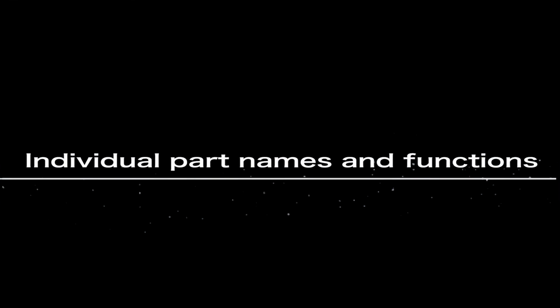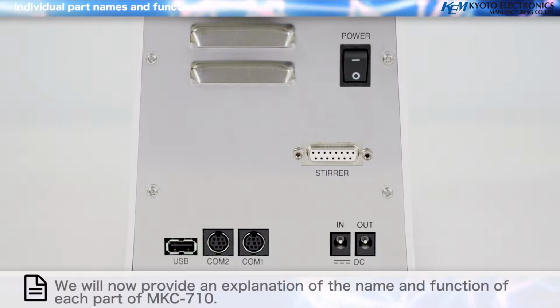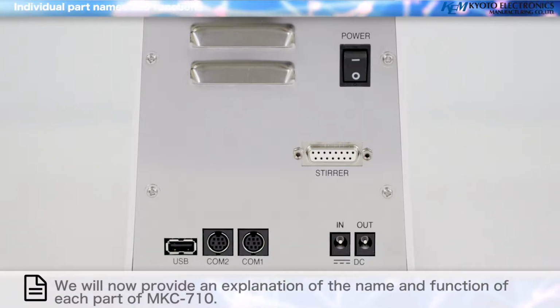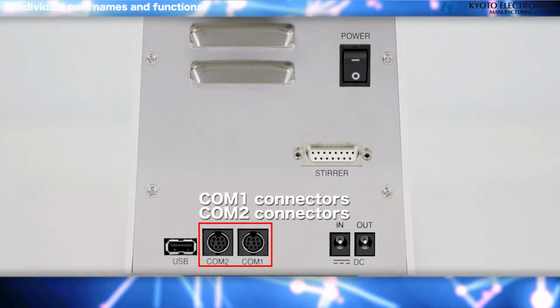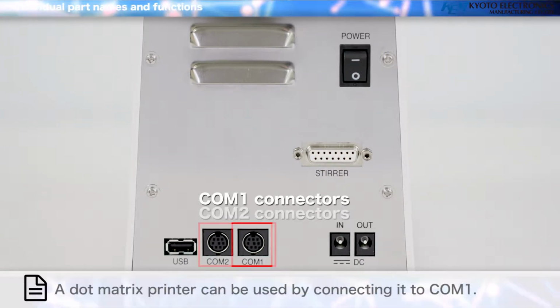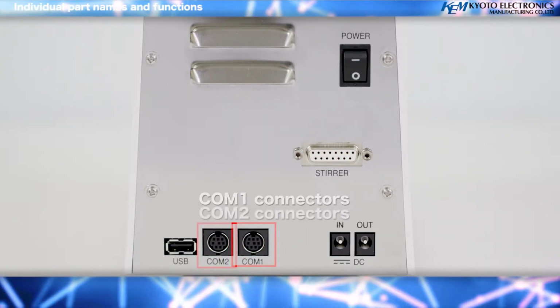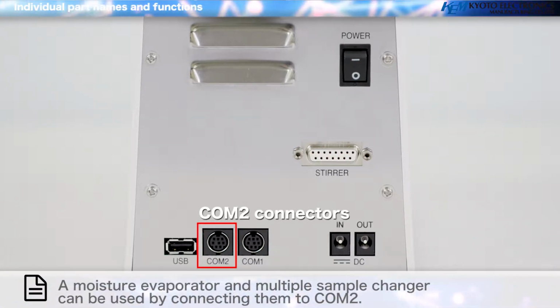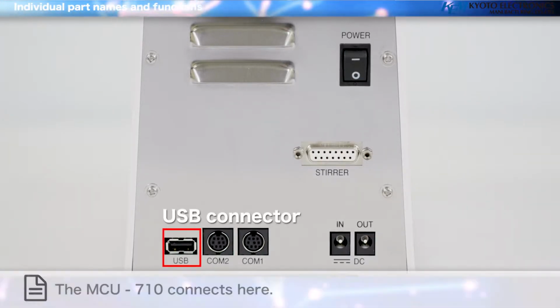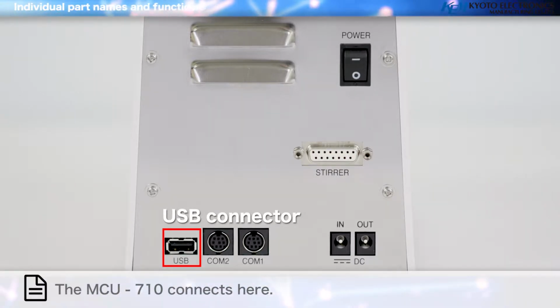Individual part names and functions. We will now provide an explanation of the name and function of each part of MKC710. COM1 and COM2 connectors. A dot matrix printer can be used by connecting it to COM1. A moisture evaporator and multiple sample changer can be used by connecting them to COM2. USB connector. The MCU710 connects here.